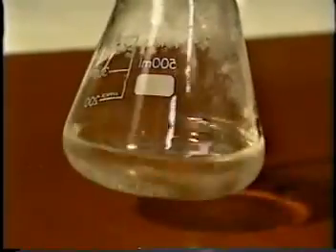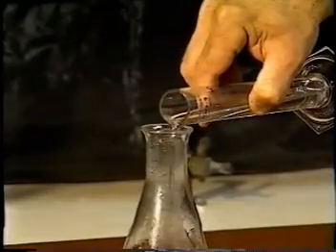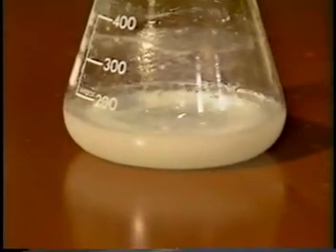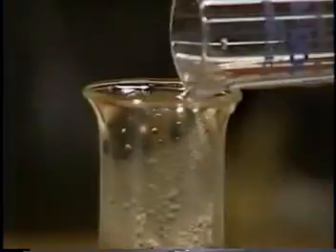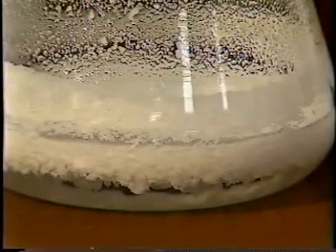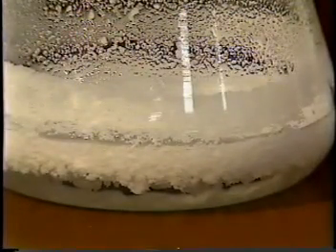We slowly add 50 milliliters of 2 molar sulfuric acid and swirl it to ensure uniform neutralization. The acid is added a bit more slowly now, as the neutralization is almost complete, and a precipitate is forming. We have now precipitated out our benzoic acid. We'll cool our solution in ice, so we get all of the benzoic acid out of the solution, and then we'll be able to filter it off.